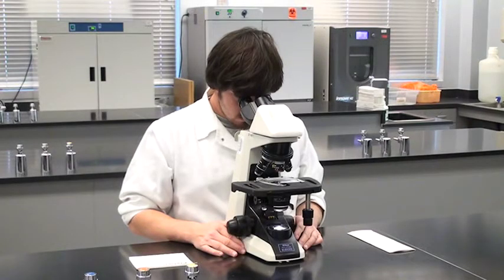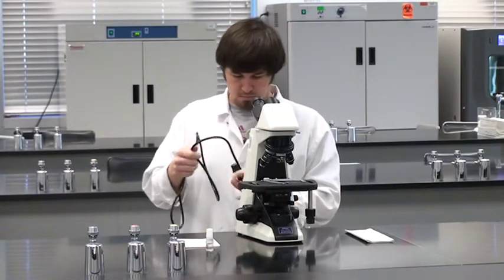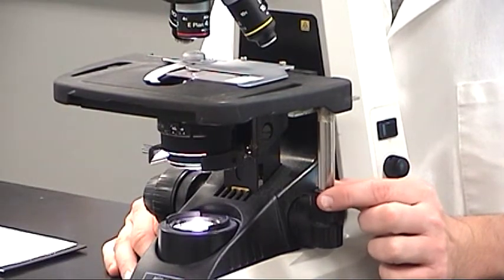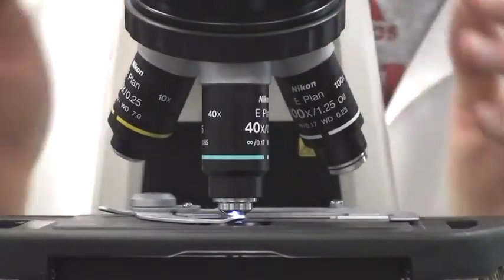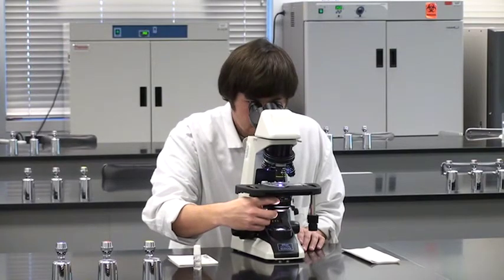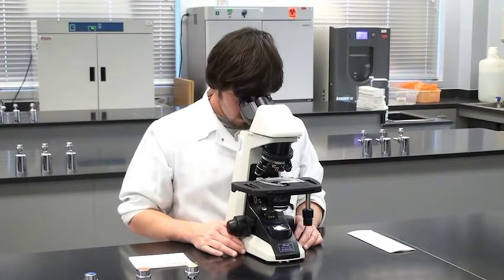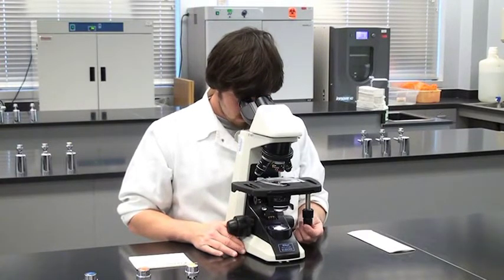You have seen the basics of how to use a microscope: setting it up, adjusting the oculars, finding a specimen, changing magnification, and adjusting slide lighting. If you take time to practice these skills correctly, they soon will become second nature and will serve you well as you explore the world of microbes.